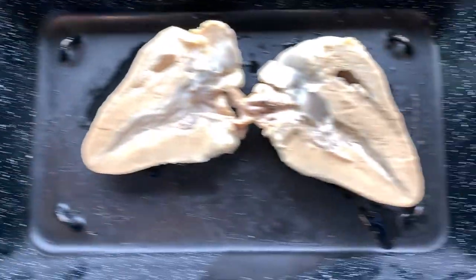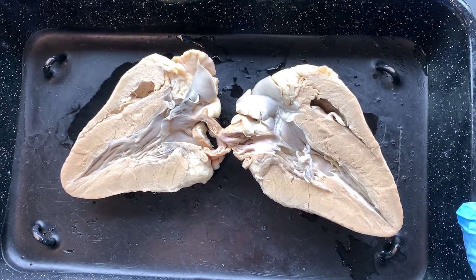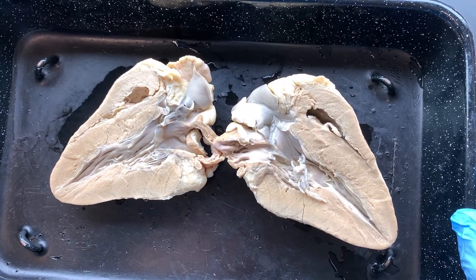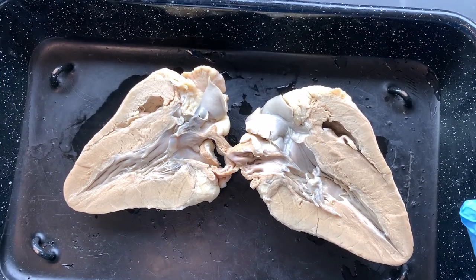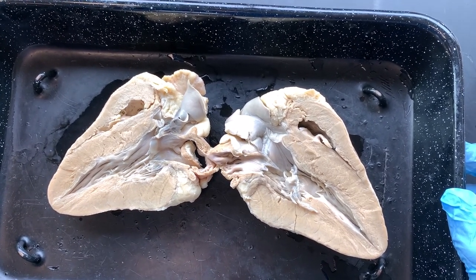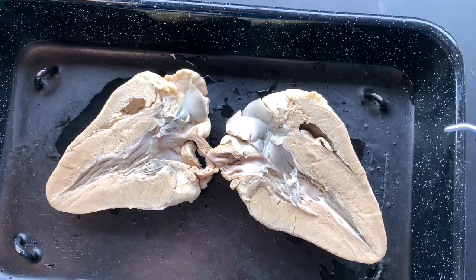What we're looking at in this specimen is we can see the right and left ventricles just based on size. Remember that you try before you buy — your tricuspid valve is the first door you have to shut between the atria and the ventricles, and then the bicuspid valve is the last door you shut between the atria and the ventricles on the left side. By doors, of course, I mean valves, and we know that the valves shut at the same time, but we're just tracing the path of blood through the heart.